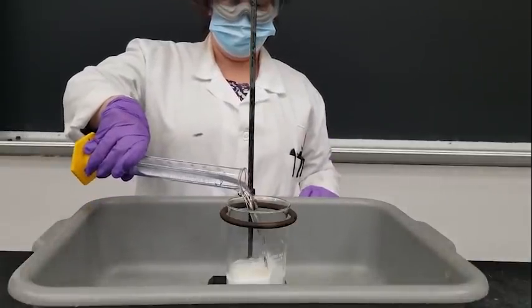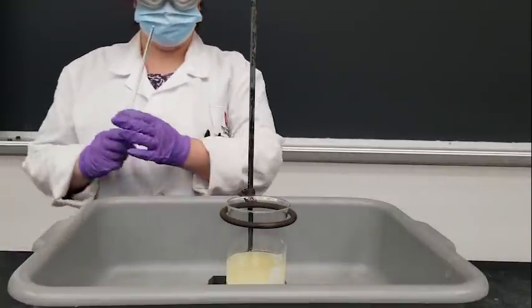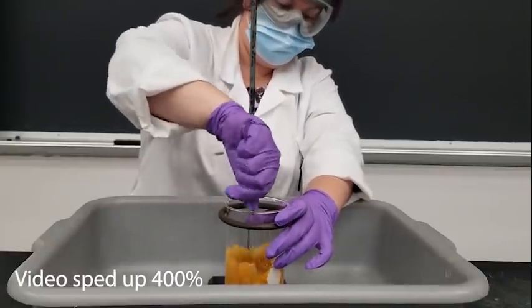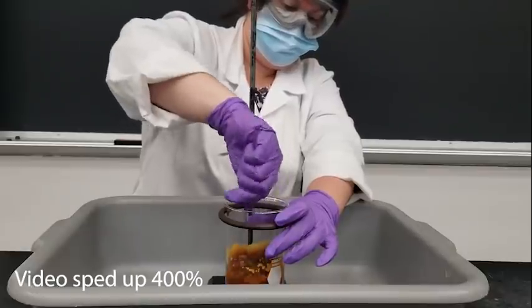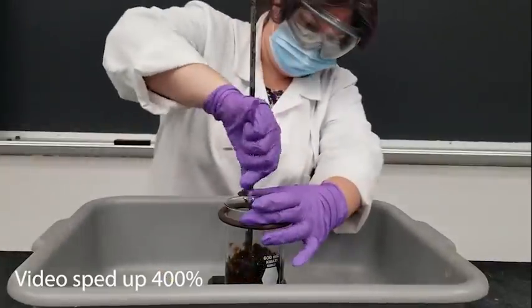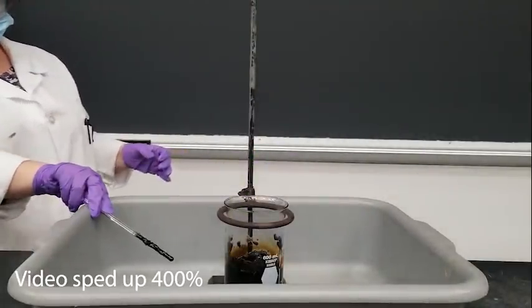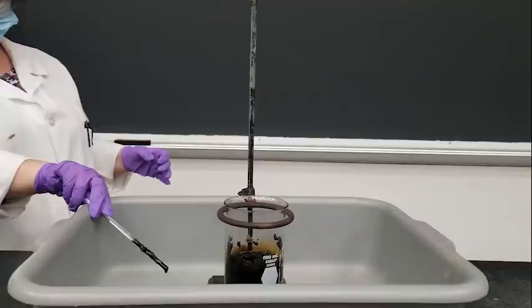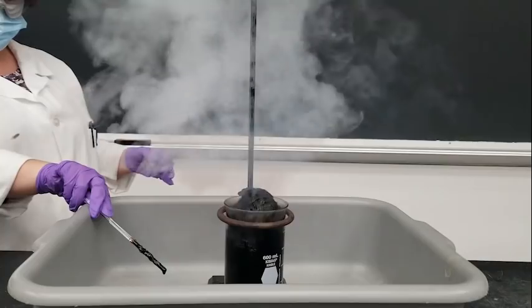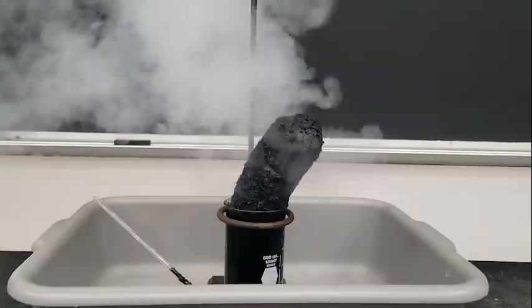Here I have some white sugar, and I've added concentrated sulfuric acid. The acid dehydrates the sugar, releasing H2O in the form of water vapor and leaving behind the carbon, which expands.